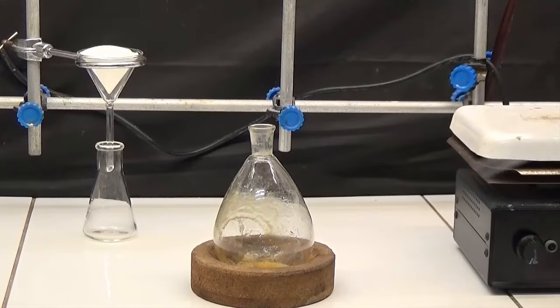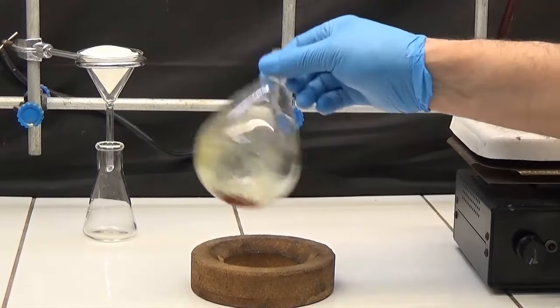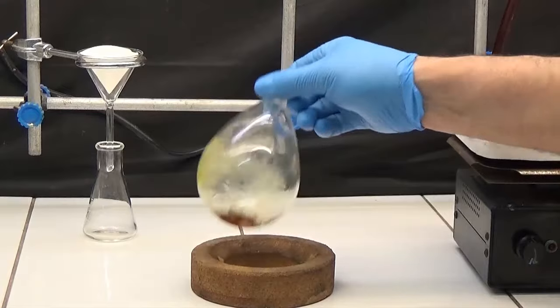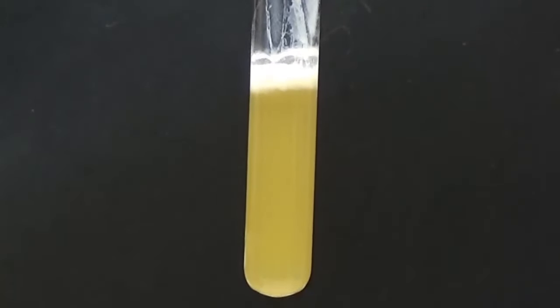Add 10 milliliters of ethanol and stir vigorously. Decant the ethanol and add 5 milliliters of ether to precipitate the amygdalin.